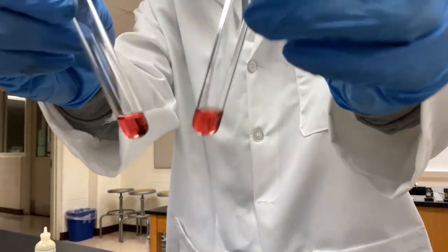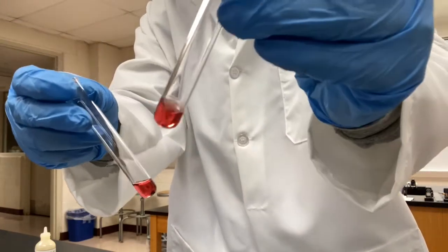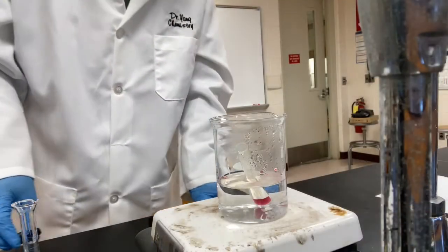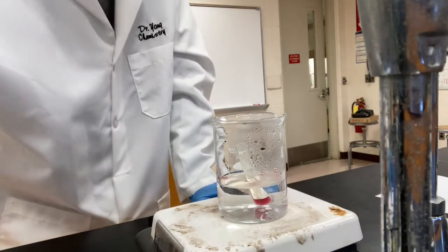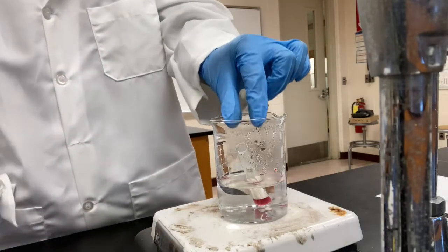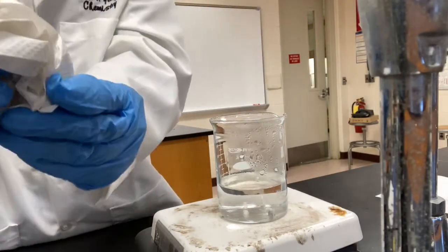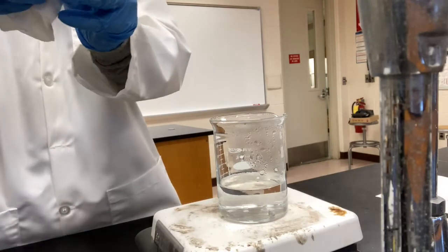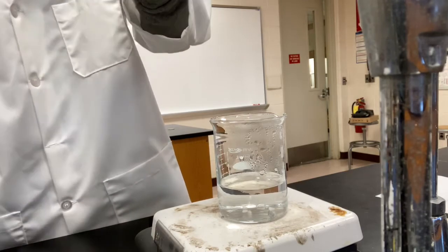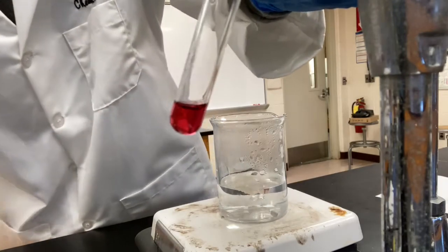Now, I made another sample of the cobalt 2 chloride. Okay, I'm gonna leave it in the boiling water bath. Okay, the sample has been here for about 8 minutes-ish. So let's take a look of the color. Oh, it's hard to see whether the color changed or not. Okay, let's compare with our control.